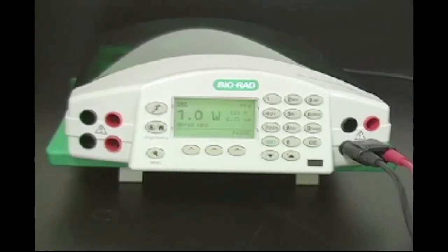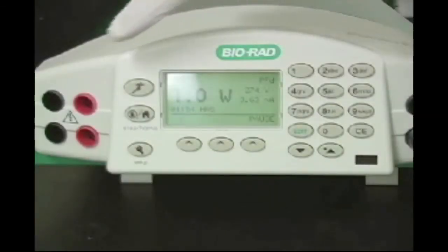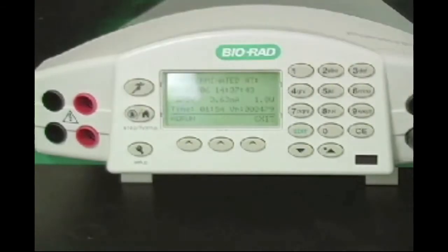Monitor the focusing progress by observing the voltage increase over time. The run is complete when the voltage stabilizes. At that point, allow the run to continue for 30 minutes before harvesting.